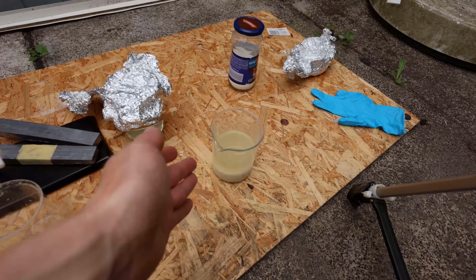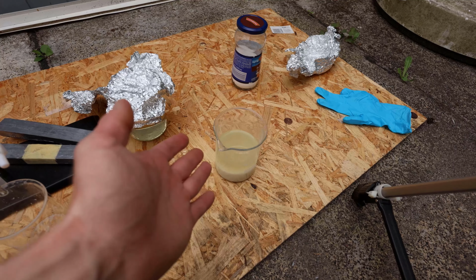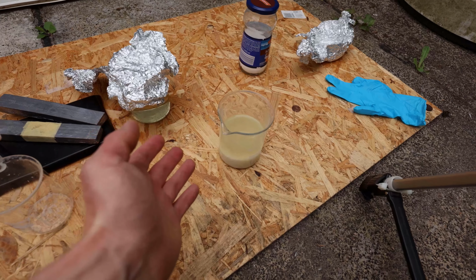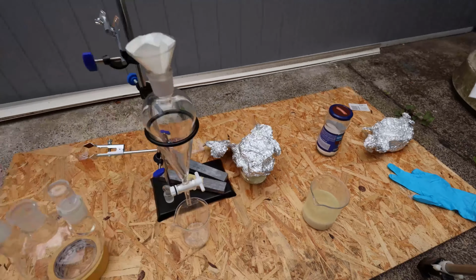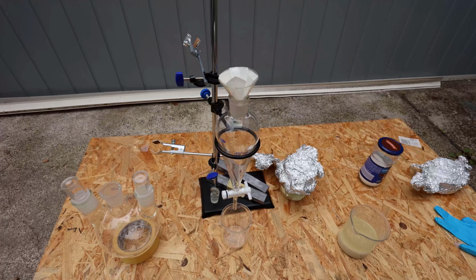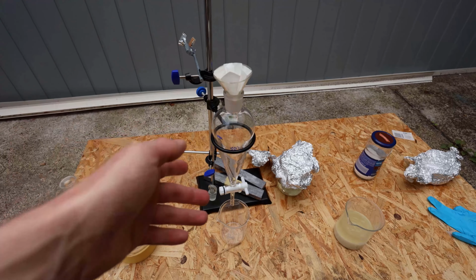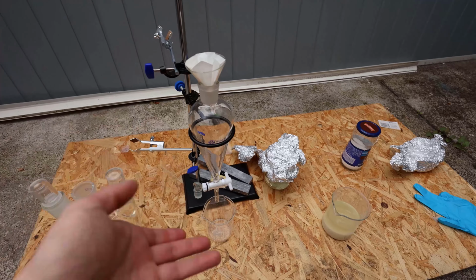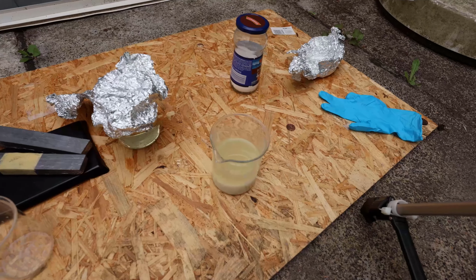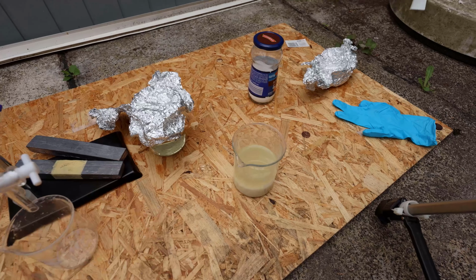I put heaps of sodium carbonate in there and it's supposed to get clear, I think, but I put so much in there already. So let's just add this to the separatory funnel, filter this, see if there's any water separating out, and let's see how this works, or if I just removed all of the water with this step already.